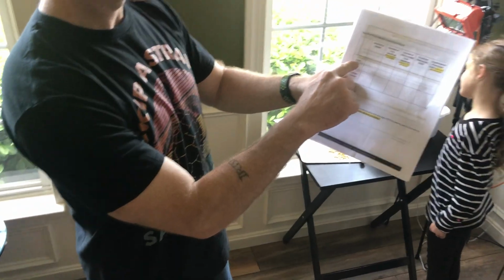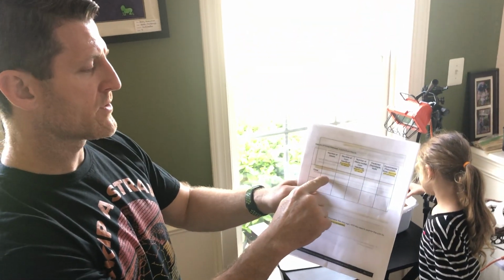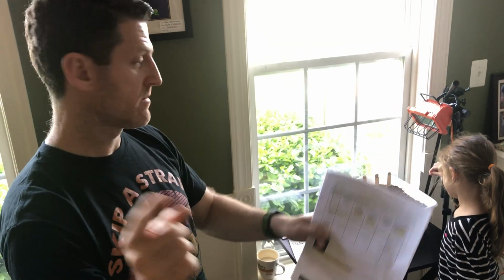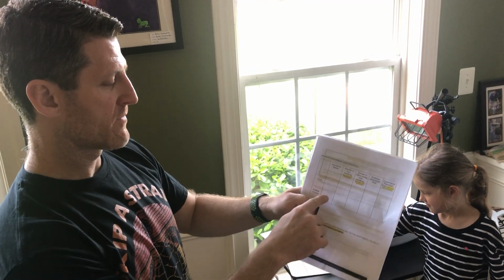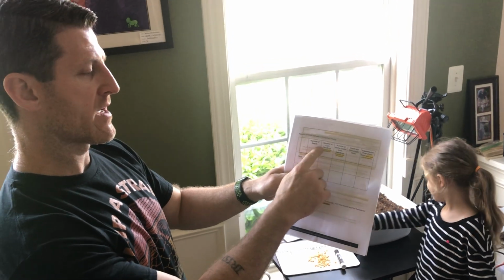Anyway, you'll notice for a class, we'll have to put numbers. So there's 6 seeds per class. 6 times 4 is? 24. Correct. Good job, Mrs. McGough. So you put 24 here. This stuff here, you can't do anything yet, so that's why it's in yellow. It says leave blank until they sprout into seedlings.